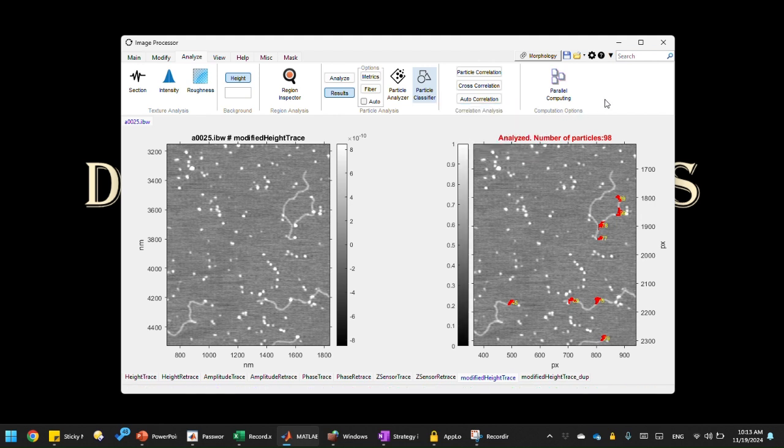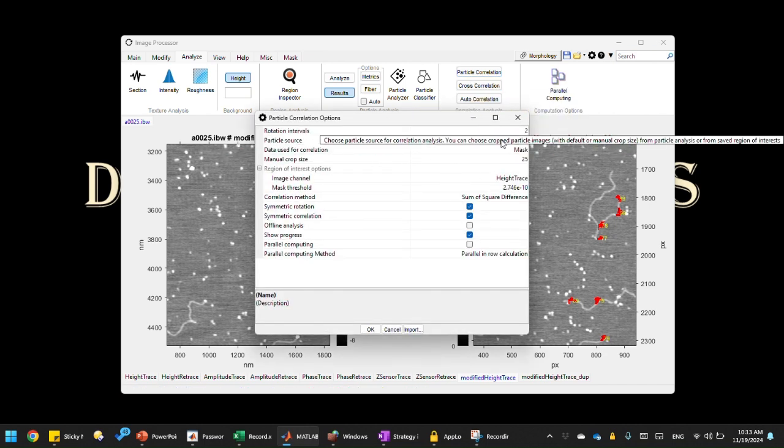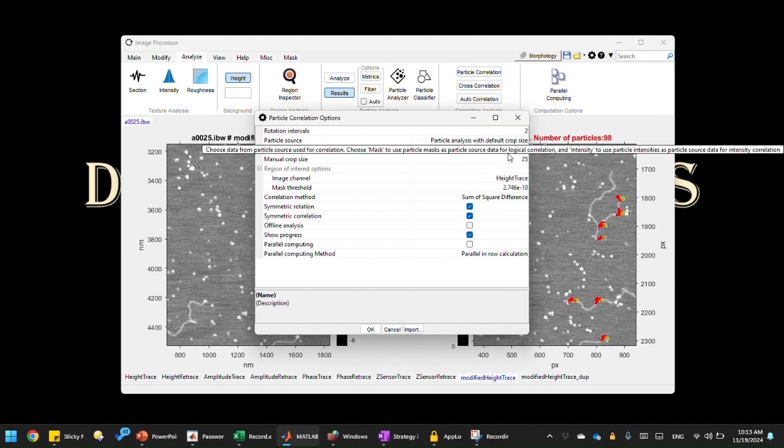I've already done that. And of course, you need to perform a particle correlation analysis first. You click on that, and you select the particle analysis with default crop size. And then here you would use the data used for correlation. Okay, this is important.